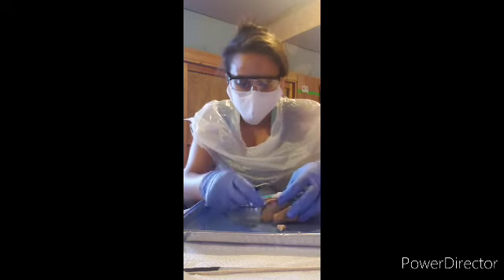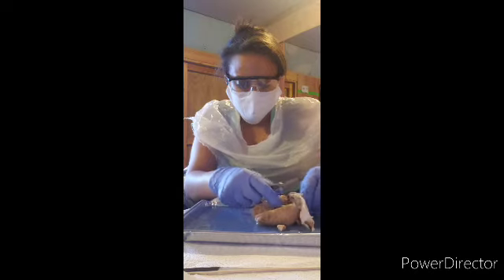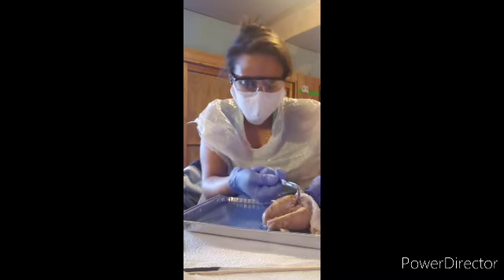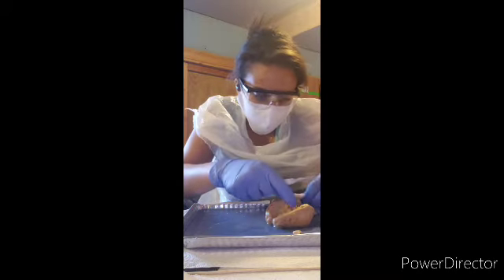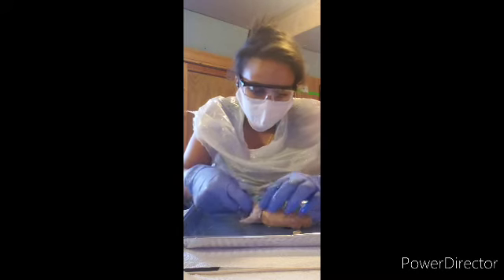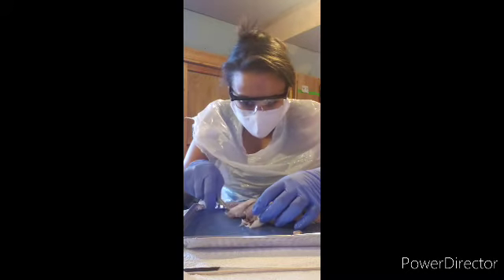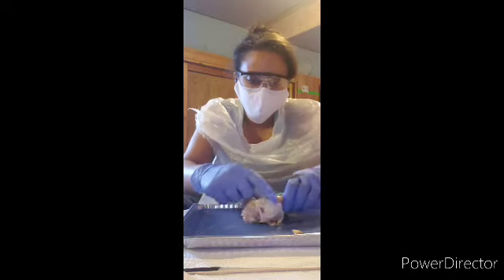I'm trying so hard not to break these two fully apart. But I just noticed what I was doing wrong. Let's just stitch this right here. Come on, buddy. We know you don't like showing your skin of a brain, trying to protect it. But you're dead, so we need to show it. Well, we're going to soon show from this part.